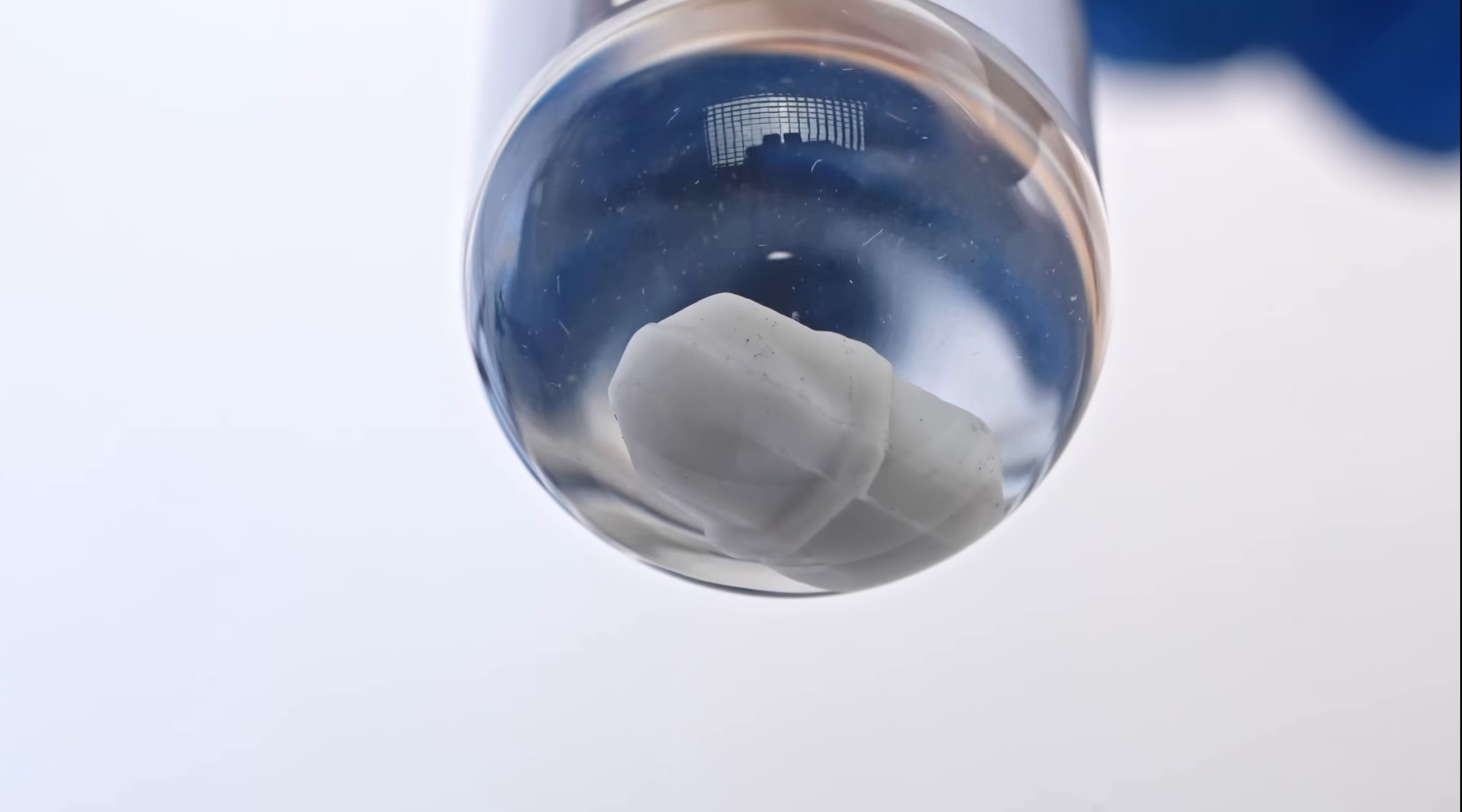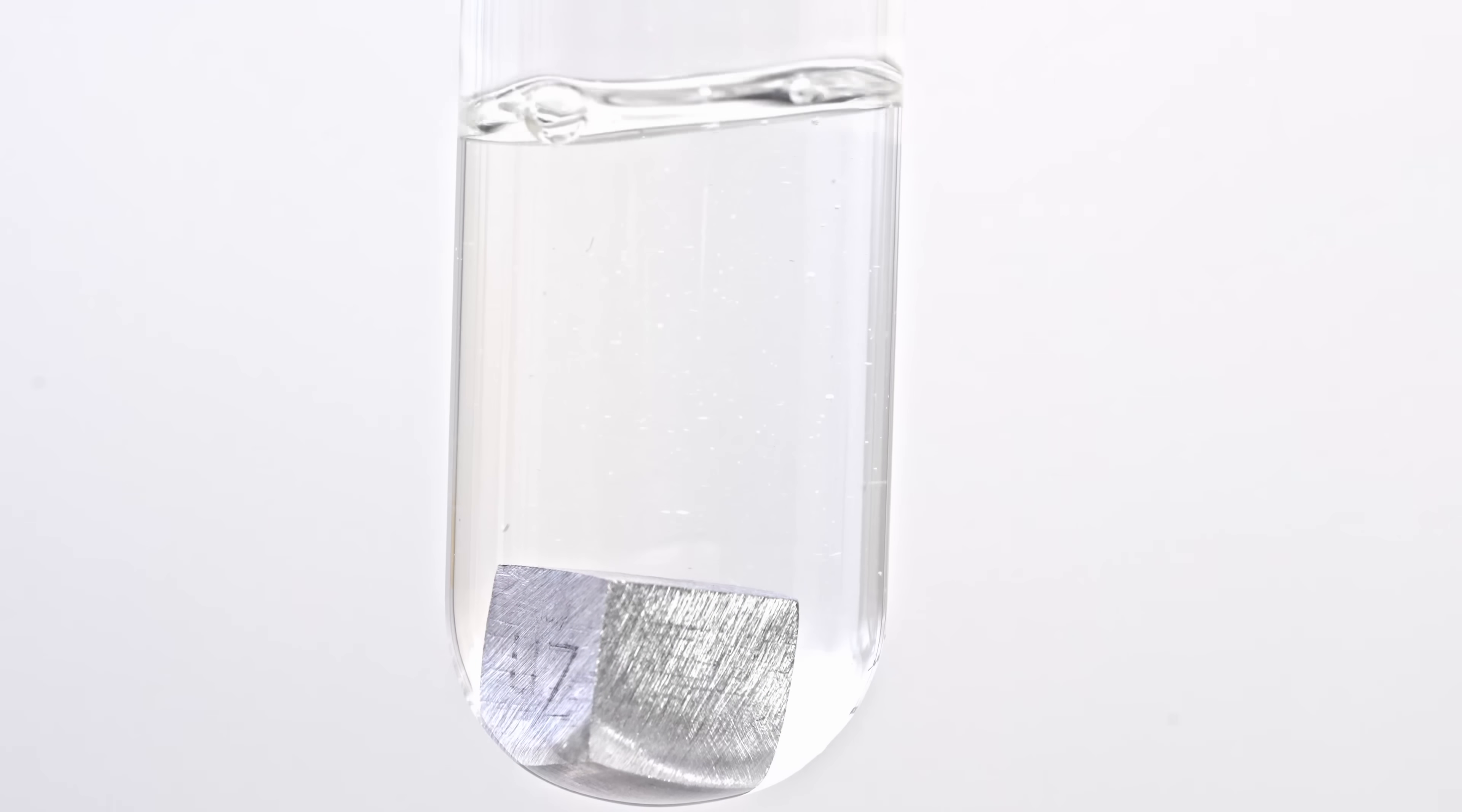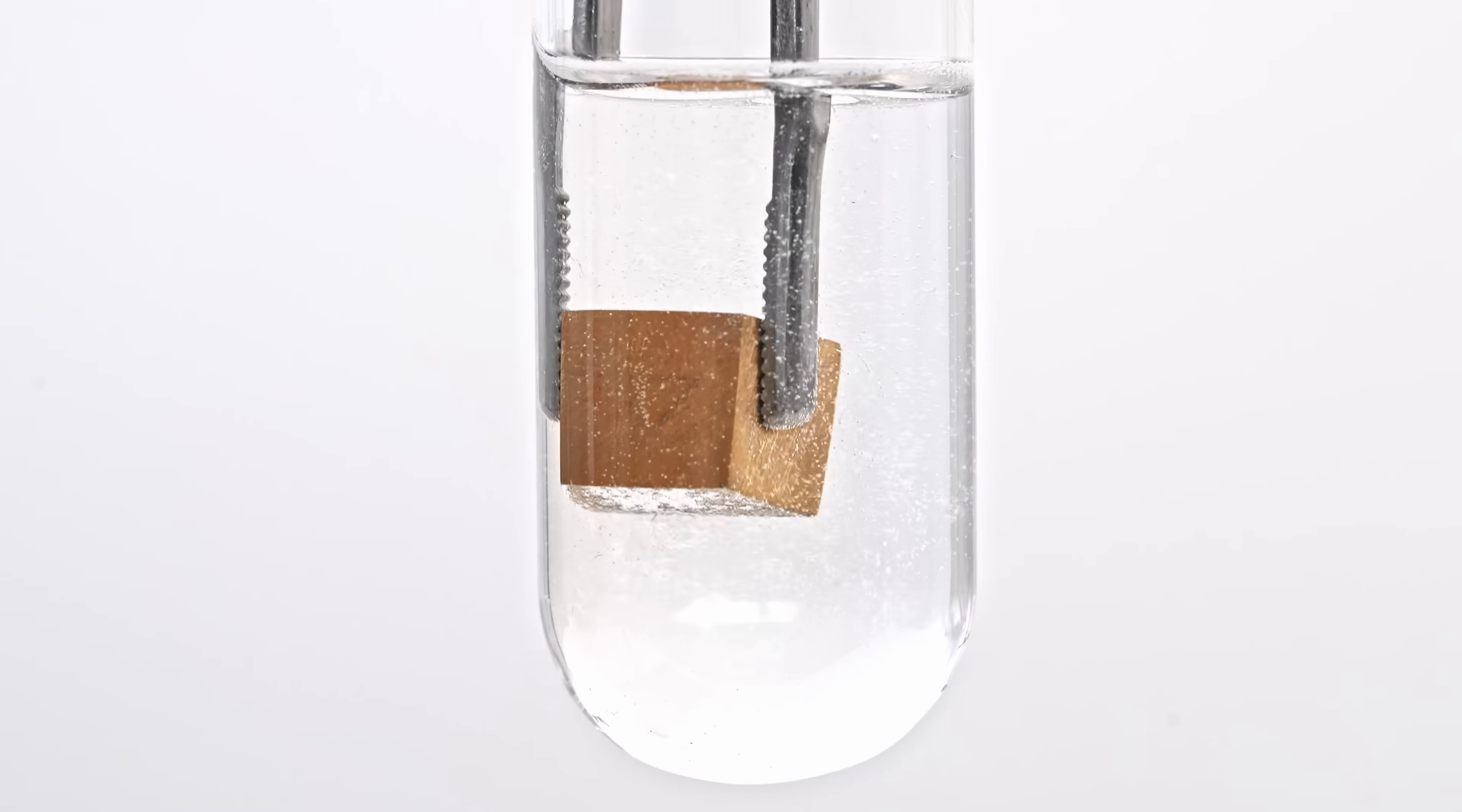Although, in industry, a process of dissolving gold in cyanide can take weeks. To prove that the gold dissolves in the cyanide solution, I placed a zinc ingot in it. Since zinc is more active than gold, it displaces it from the solution, becoming covered with pure gold.